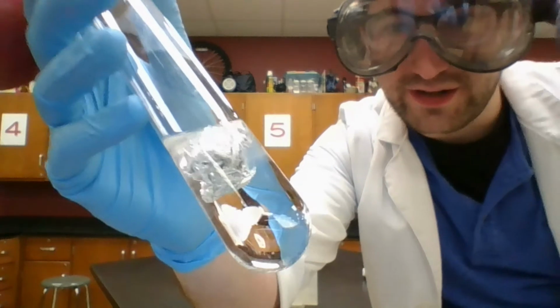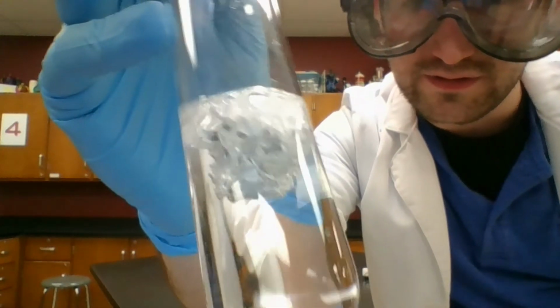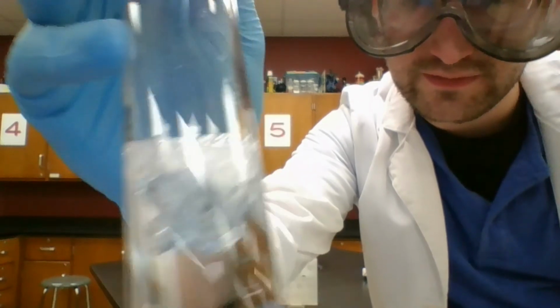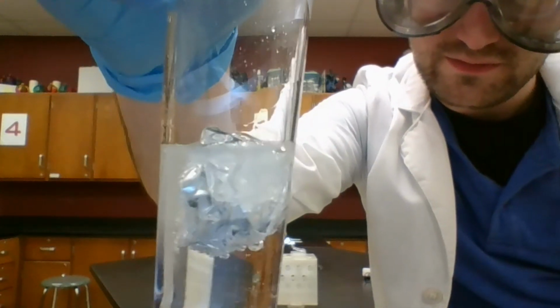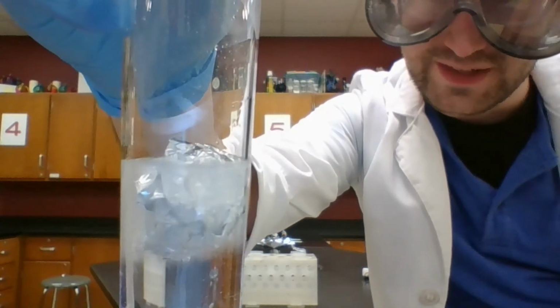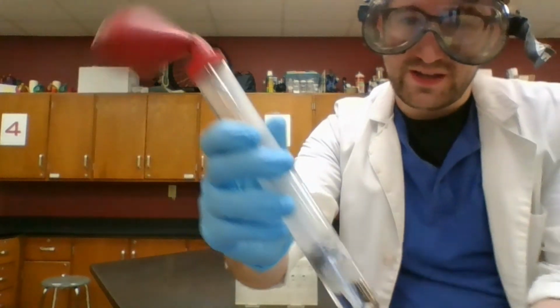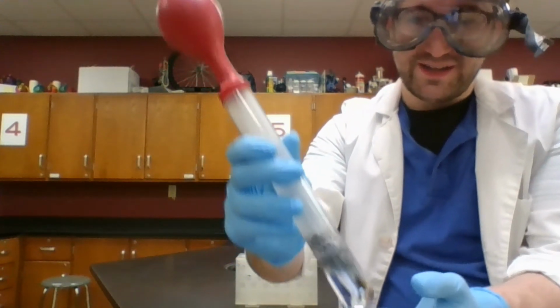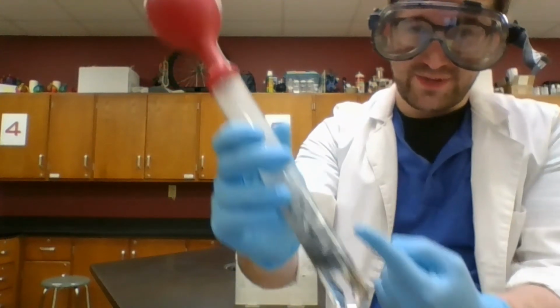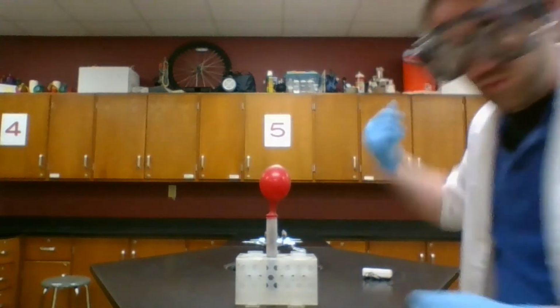Now, if I get this a little bit closer, I might be able to see little bubbles fizzing. And now we've got something going on. Bring this back a little bit. And there goes my balloon. So I'm capturing some gas up here, and this is getting too hot. Oh, I have to put that down. Whew.